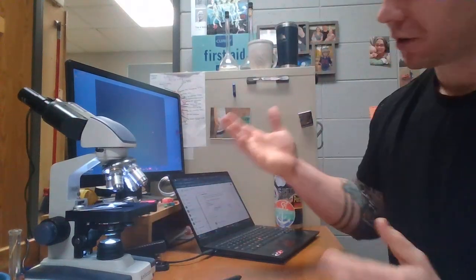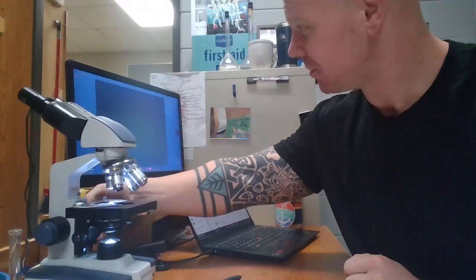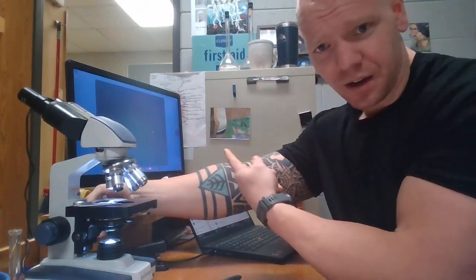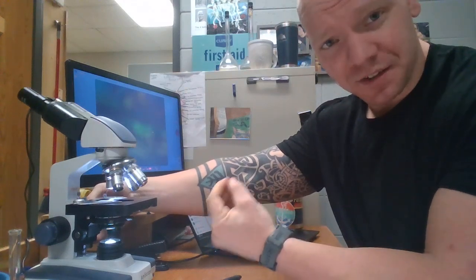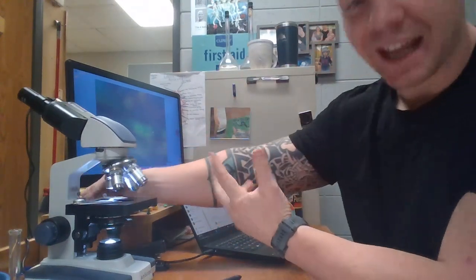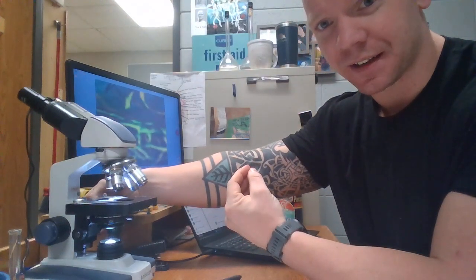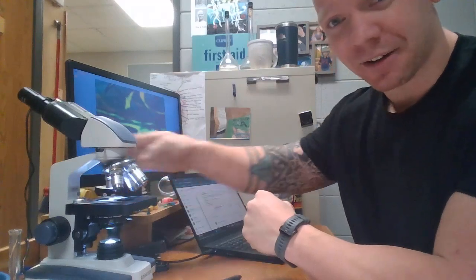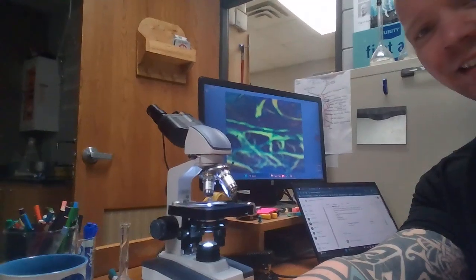All right, so in order to do my coarse and fine adjustment, I would normally look into the eyepiece and then use my coarse adjustment to zoom in. You can see in this back screen here that I am getting closer and closer to this slide, which is going to be some intestinal slide that I have for my anatomy classes. And in here, you'll see that it is starting to take shape. All right, and as I start to get more shapes, I'm going to start using my fine adjustment to bring greater clarity to that. You can see in the background here that I now have distinctive, looks like smooth muscle tissue in that slide.